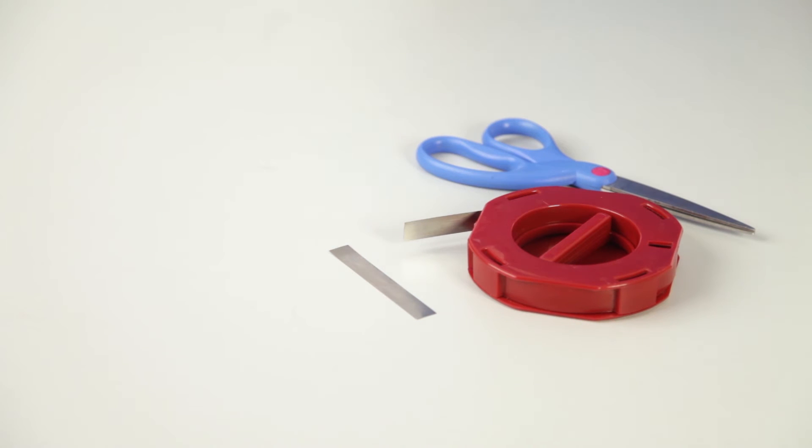While the furnace is heating, cut the appropriate length of metal shim to complete a full circle within the metal melt ring.